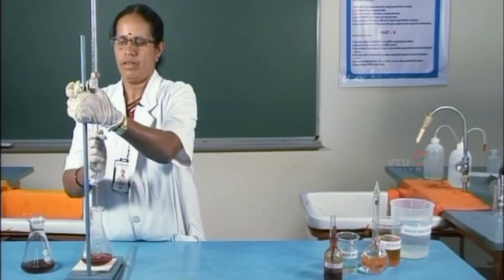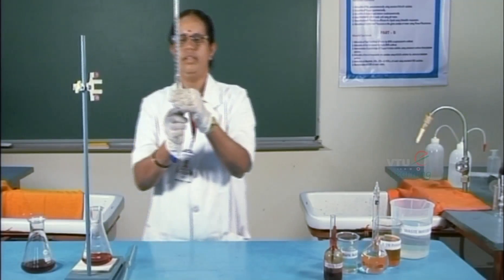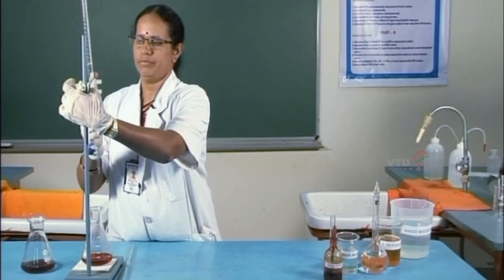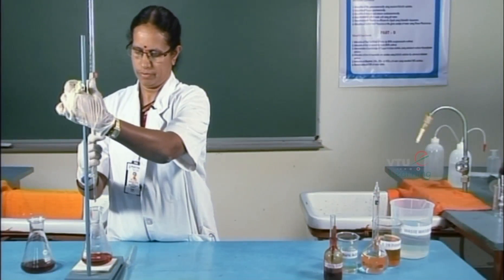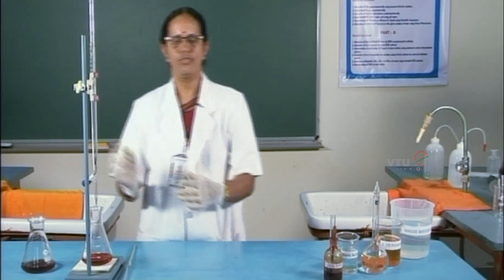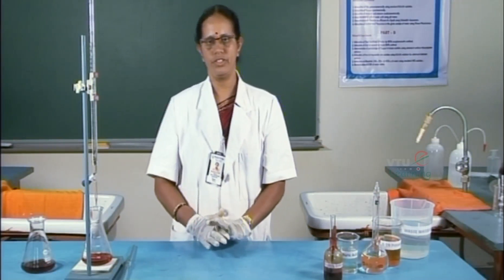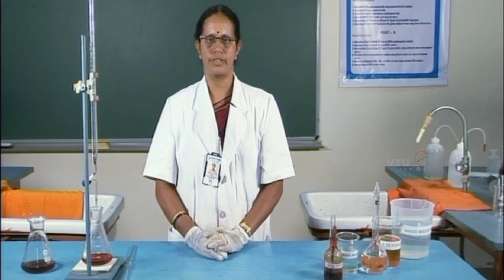The blank titration is estimated against the potassium dichromate solution. The initial reading is 11.7 and the titration is started. The color change is from green to reddish brown. The final burette reading is 36.4. Two more titrations are conducted for concordance.